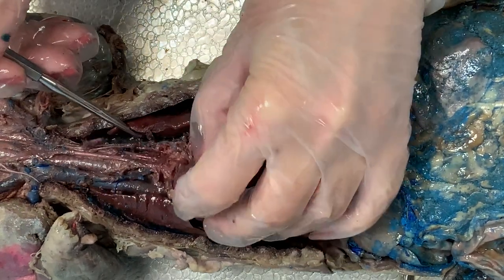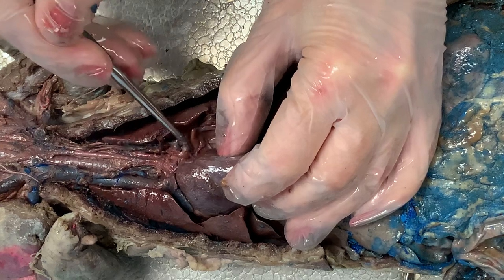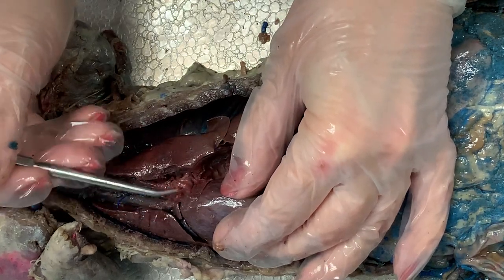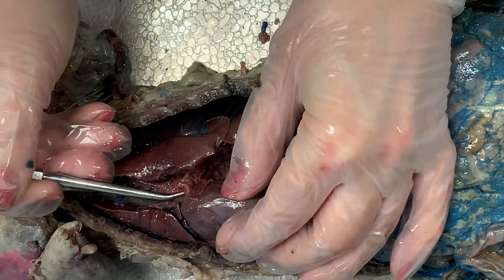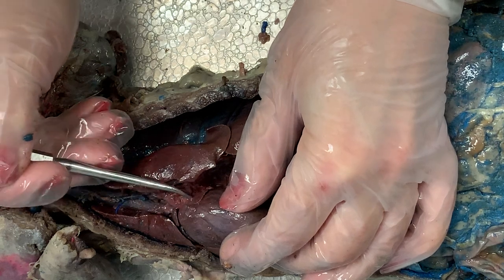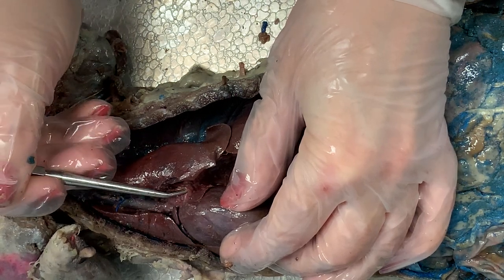We can also see two arteries. This mink is not the best specimen, but between the right auricle and the left auricle is the pulmonary trunk — that's an artery running right here. If you look between the auricles, the pulmonary trunk runs right through. It's carrying blood away from the right ventricle.